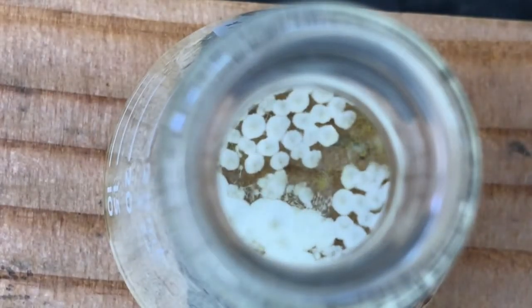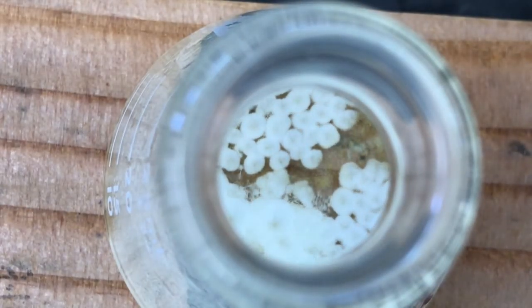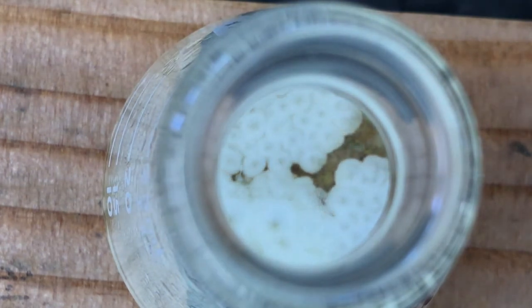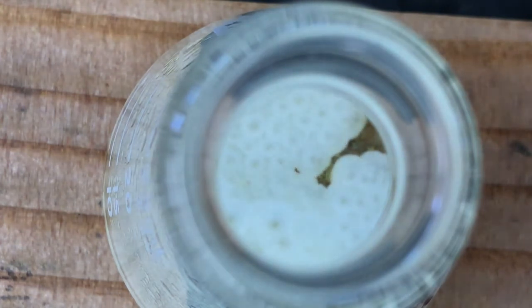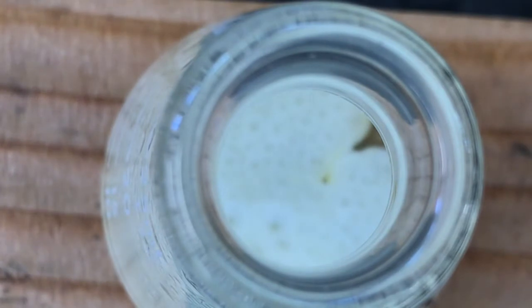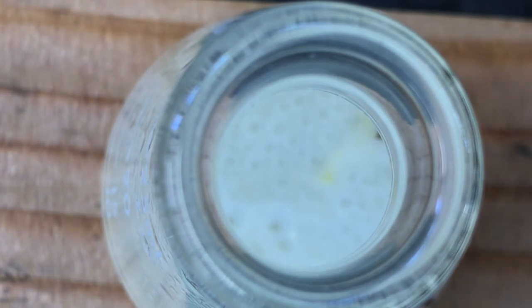So this happens sometimes when you crystallize something. If it's not going and you disturb it a little bit, it initiates the crystallization quickly. So this is maybe quicker than we want, but it's cool to see it live this fast. So I'll let it finish crystallizing and then I'll filter it. It'll still be more pure than when it precipitated out initially.